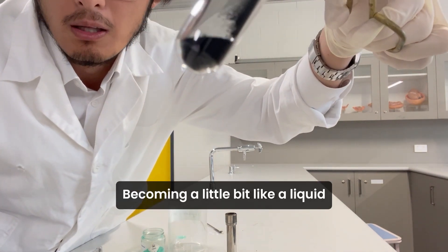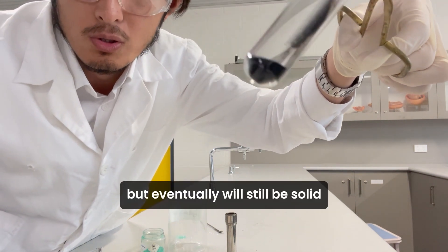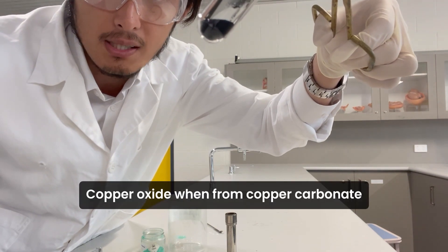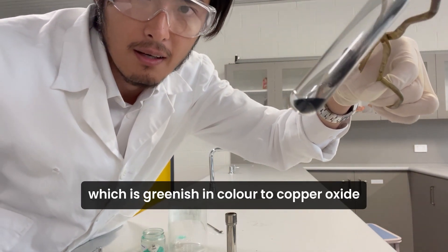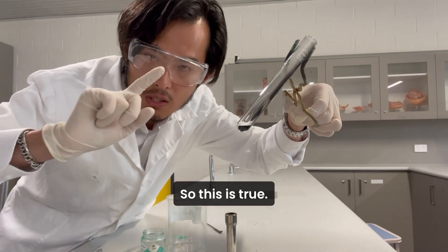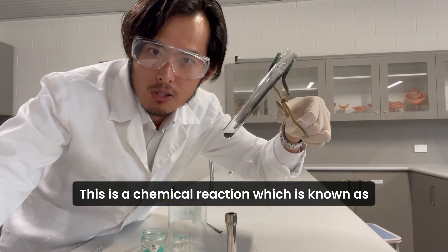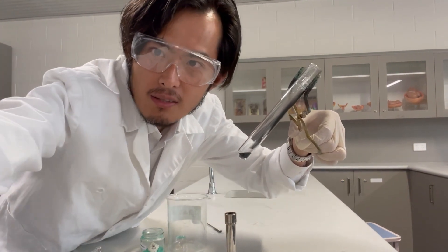It's becoming a little bit liquid-like, but eventually it will still be solid — what you have here is copper oxide. It went from copper carbonate, which is greenish in color, to copper oxide. So there is a change of color, confirming this is a chemical reaction known as a decomposition reaction.